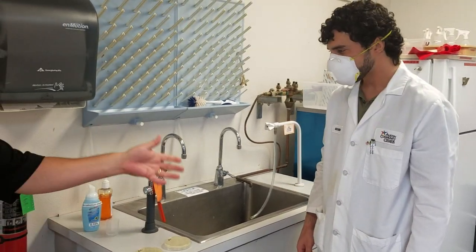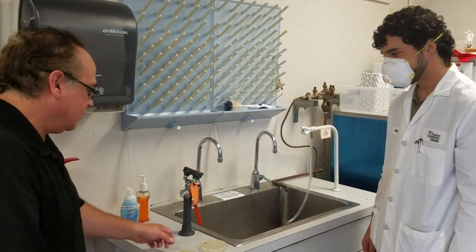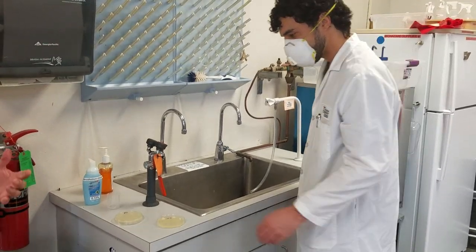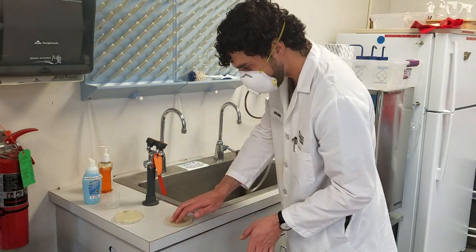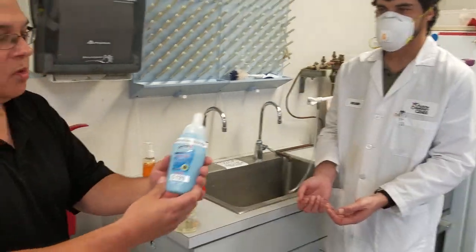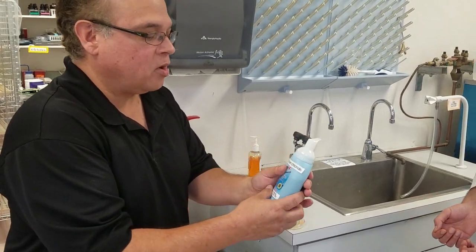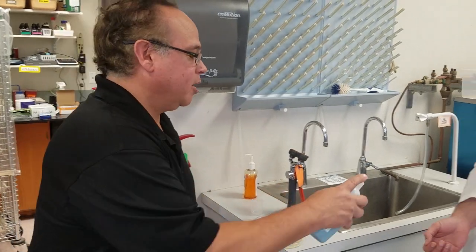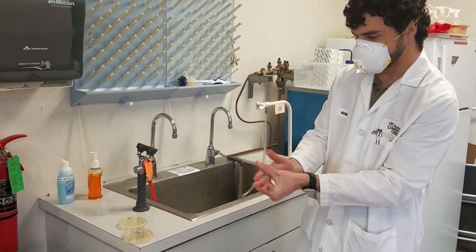This is Ricardo, and Ricardo is going to work with treatment C, which is just hand sanitizer. I've got plates labeled — one before the treatment and one after. Ricardo will expose his fingers and thumbs to the plate prior to the treatment. This is the best hand sanitizer on the market — most have just 68 to 78% isopropyl alcohol, but this one has benzalkonium chloride in it, which is a quaternary ammonium compound and is really effective. I'm going to place this in the middle of his palm, and he'll do the sanitizing method.